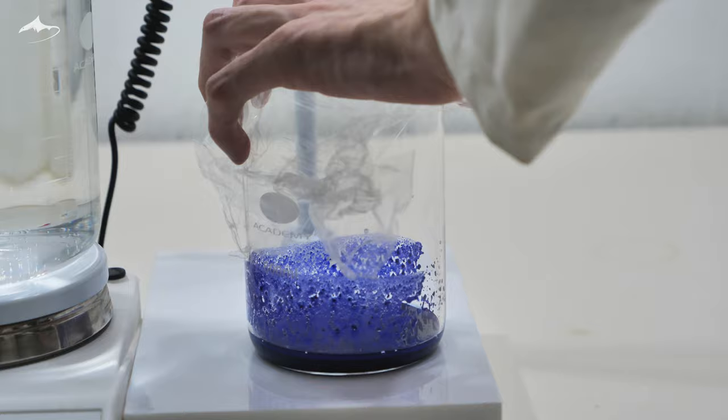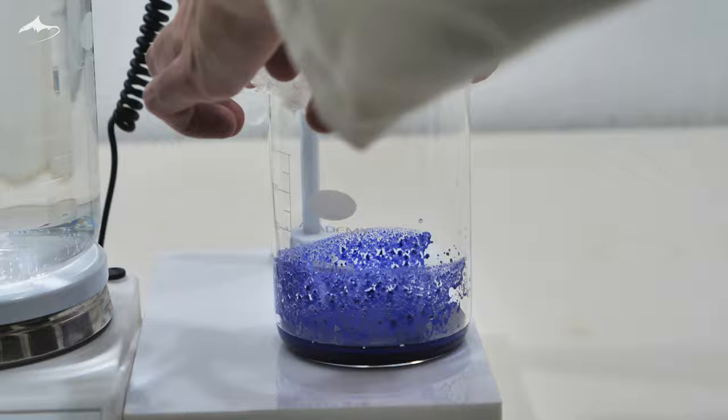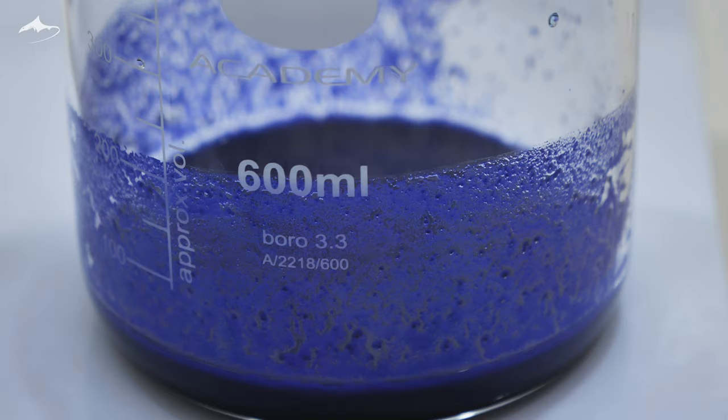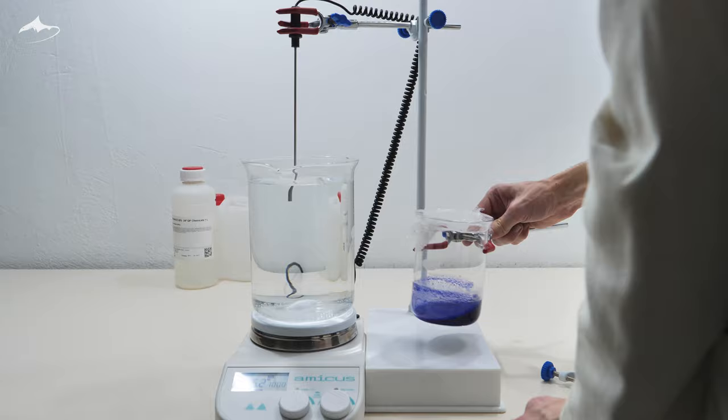This was done in the water bath prepared in advance. The beaker was covered in plastic wrap to prevent both evaporation and too much ammonia gas escaping from the solution. It is hard to see on camera but the powder consists of very small tabular or needle shaped crystals.